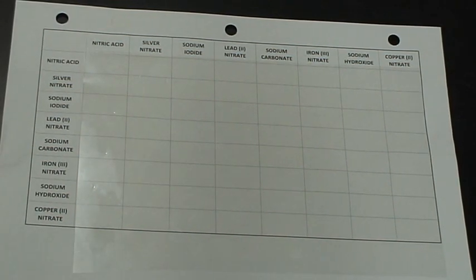In the beginning stages of chemistry, we spend a lot of time taking a look at chemical and physical properties of different compounds universally. And so in this course, we're going to be taking a look at those throughout the year with different solutions. And this is an example with the 8-solution problem. We're going to be mixing 8 different solutions together and just taking a look at what reacts and what does not react. Then we're going to be taking a look at later on using those characteristics to identify unknown solutions.